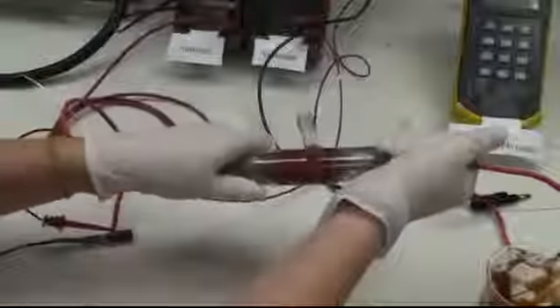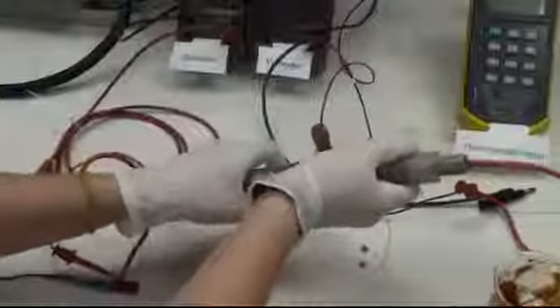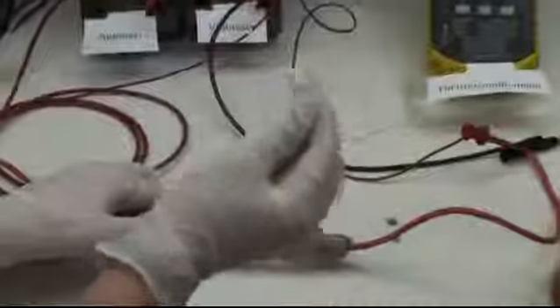First thing I'm going to do is demonstrate how to add product to the T-cell. The product we're using is tomato paste. The first thing you want to do is add the electrode to one end and then add the product into the T-cell. You want to make sure that there are no air bubbles in the product. Add the thermocouple probe into the sample.